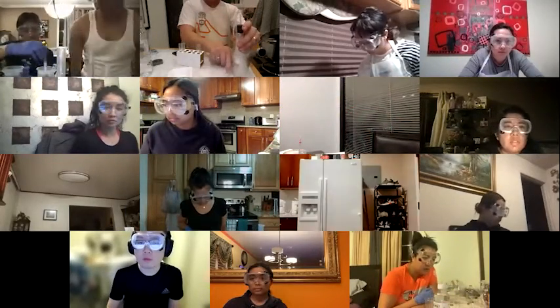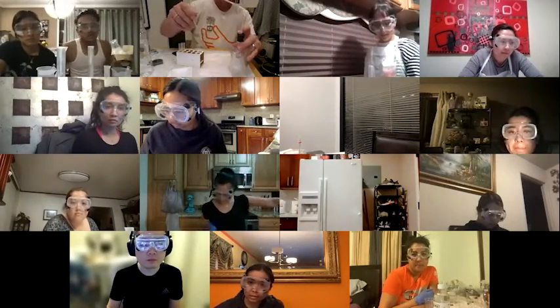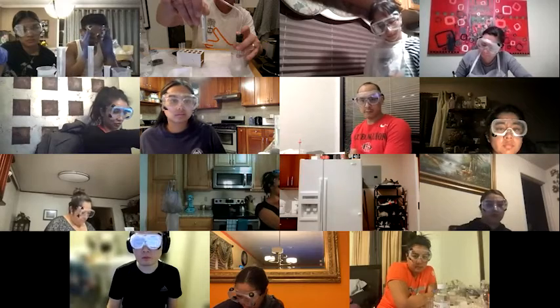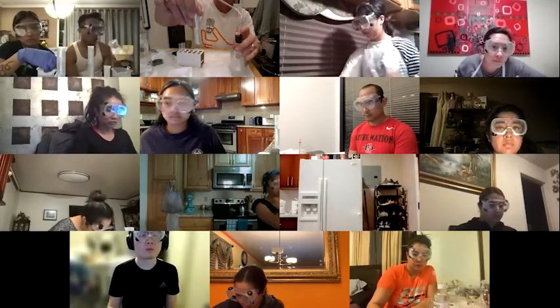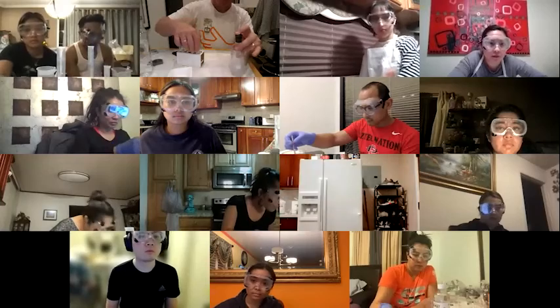Oh, there it goes. That is a rapid reaction. So you can see bubbles starting to come through here. I am going to put it in the lime water and should start bubbling. Yeah. The lime water is bubbling. So I'm bubbling CO2. Now, this reaction isn't super fast, which is maybe why we didn't have it work terribly well before.